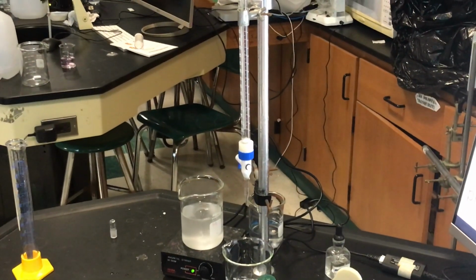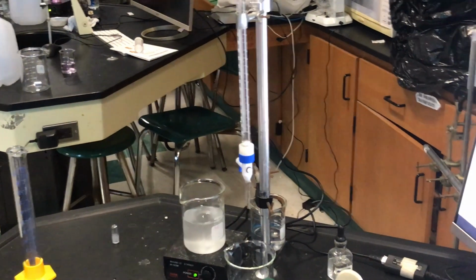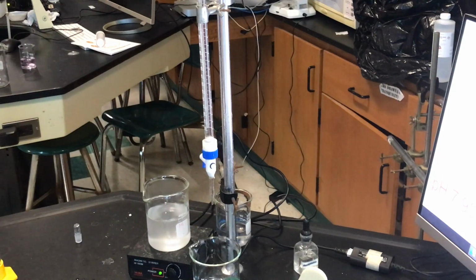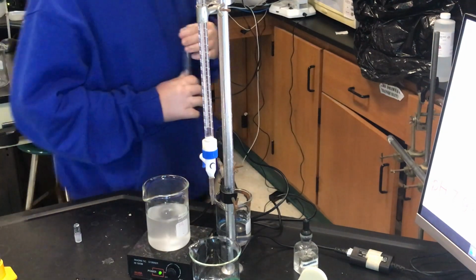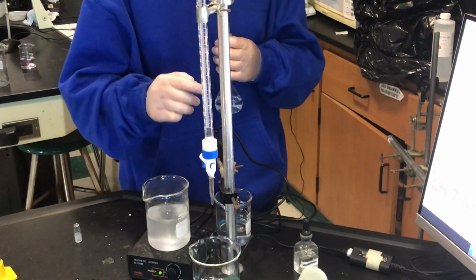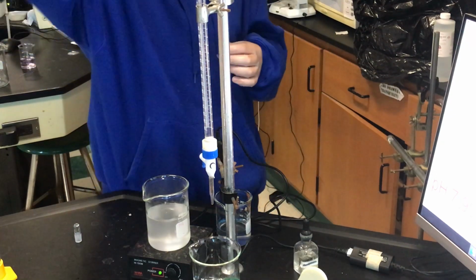Okay, so now this is what I need. Once it empties out, and it is empty, I need student E to take my acid solution and just rinse. Okay, open this up, now pour about 5 milliliters. Okay, so don't stand over stuff, stand on this side, and add that. The reason why we're rinsing is because that had base in it. Wait, so you want it closed? I want it open. I want it to run out to wash it out. 5 milliliters? Yep.